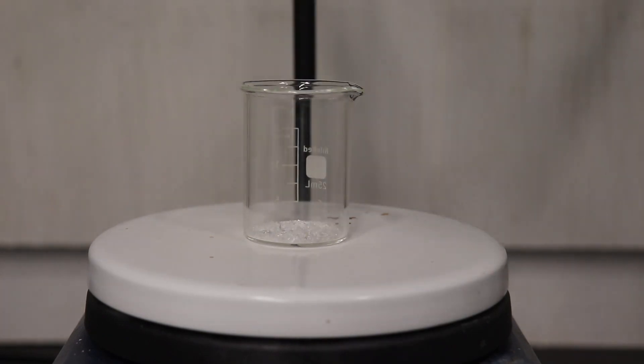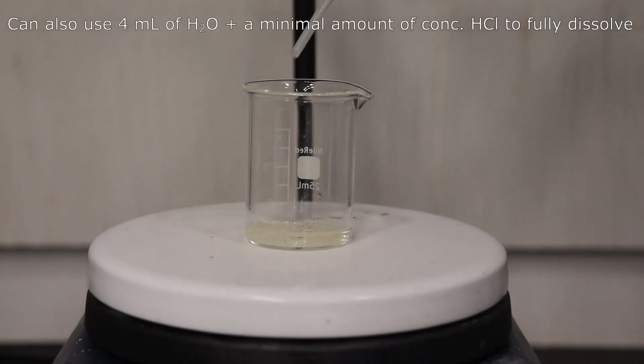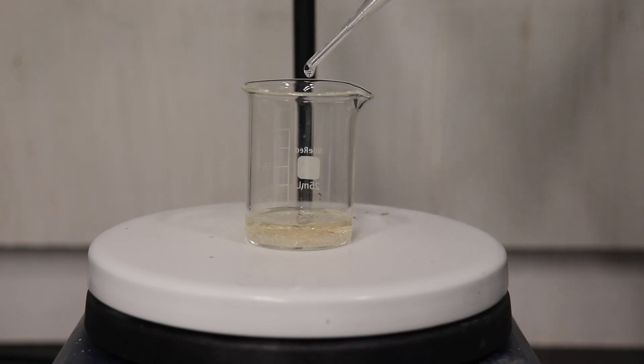The orthophenylenediamine was dissolved by adding 4 ml of 2 molar hydrochloric acid, followed by the dropwise addition of concentrated hydrochloric acid until complete dissolution.